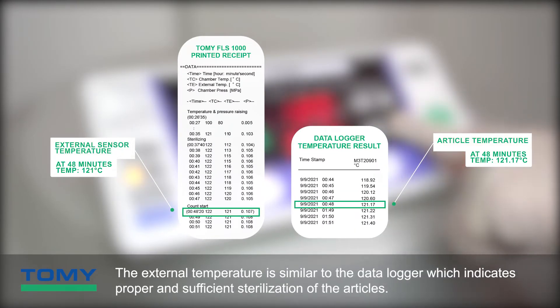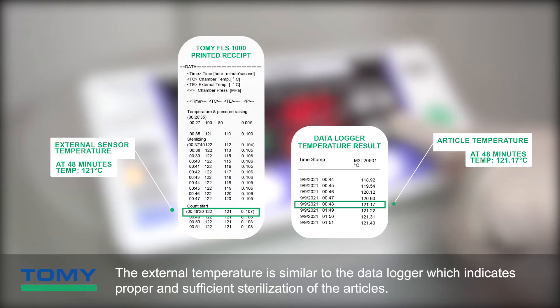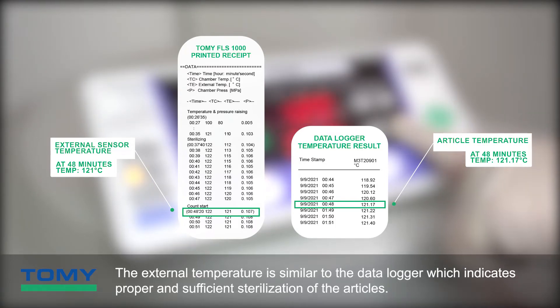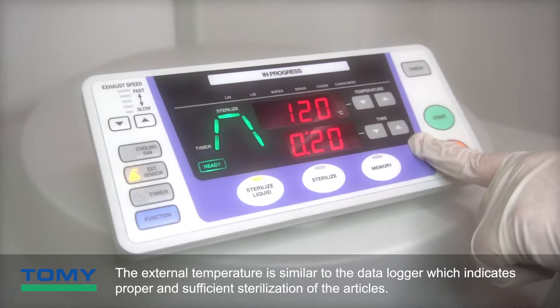The external temperature sensor reading is similar to the data logger reading, which indicates proper and sufficient sterilization of the articles.